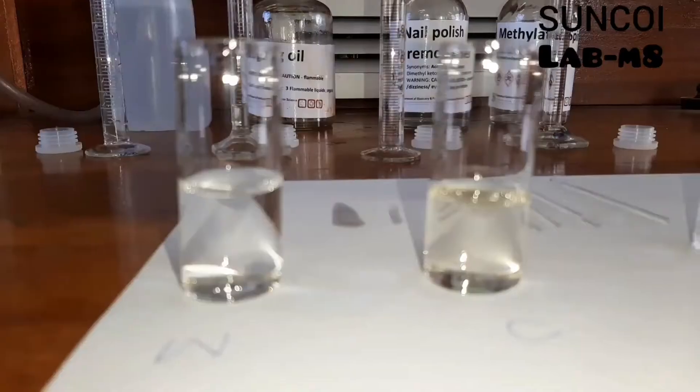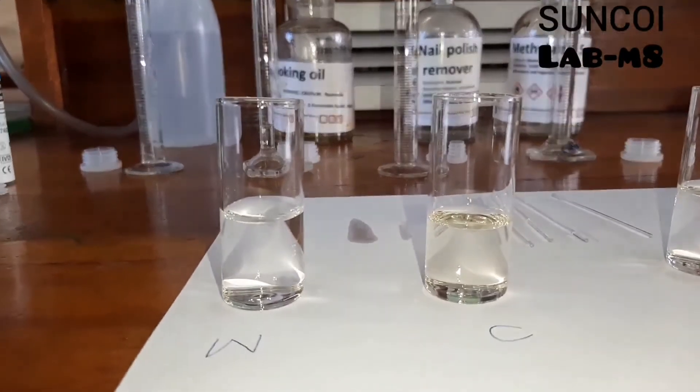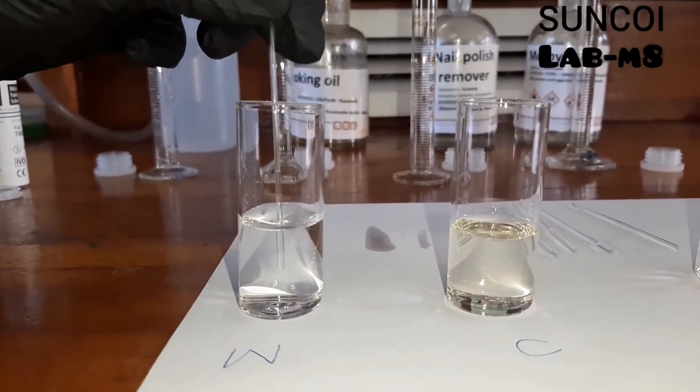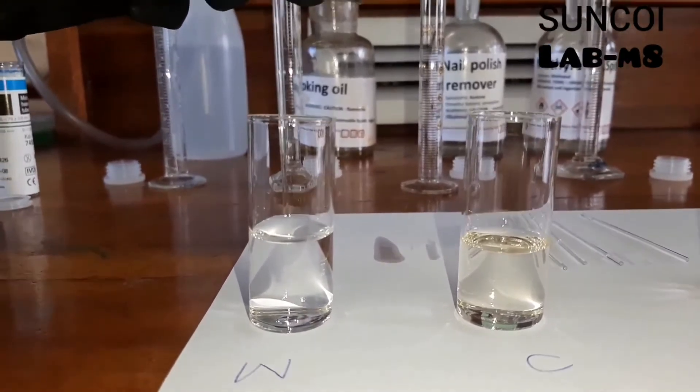We will now use capillary tubes to do this experiment. So first up is water. Just pause and check how far it travels up the tube.